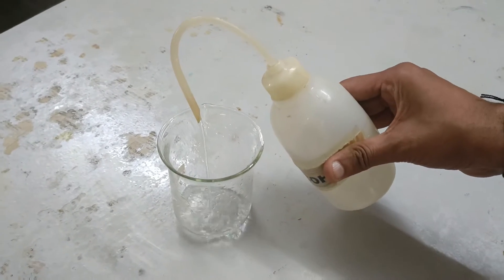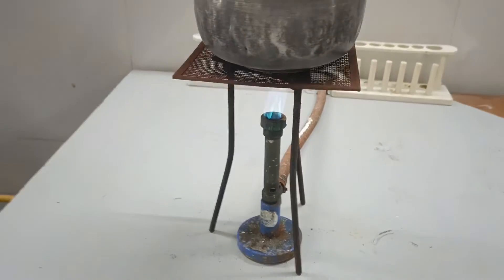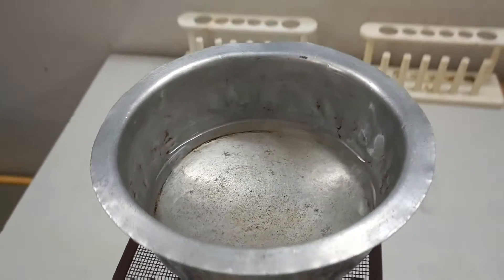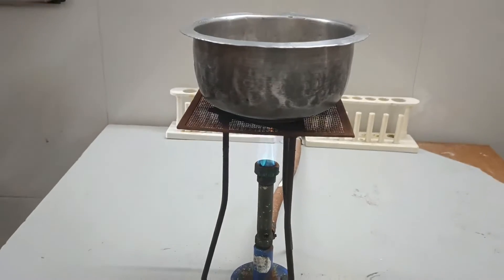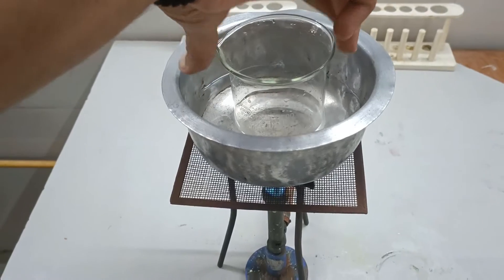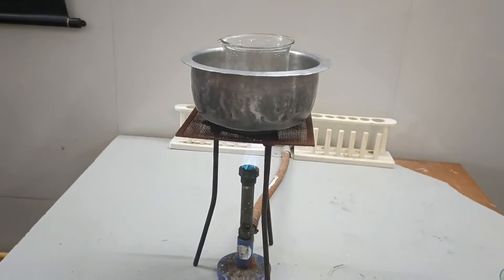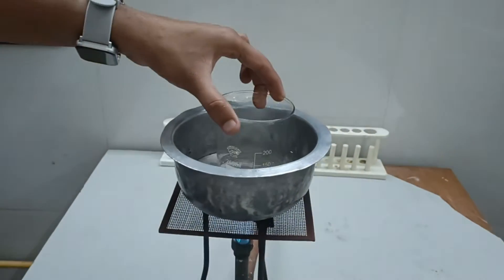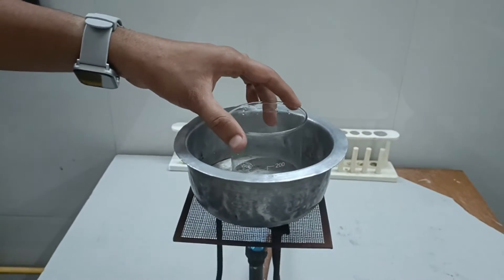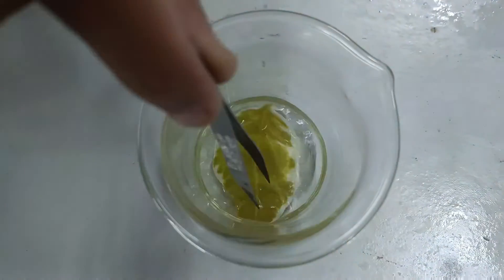Let's take some colorless alcohol into a beaker. Let's boil some water in an aluminium container — we are going to gently lower the beaker of alcohol into it. We can't directly heat the alcohol as it is highly inflammable. We will continuously shake the alcohol in the beaker so that alcohol vapors don't gather, as they are highly inflammable. Let's pull out the leaf from the boiling water and immerse it into the hot alcohol in the beaker.